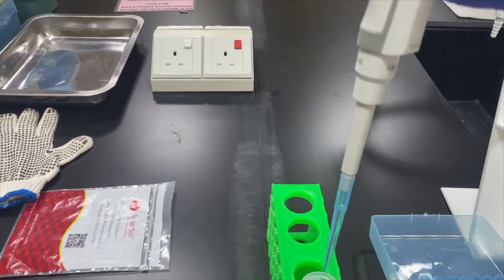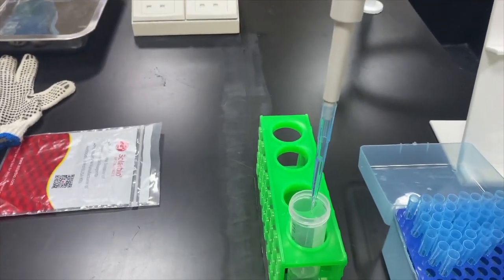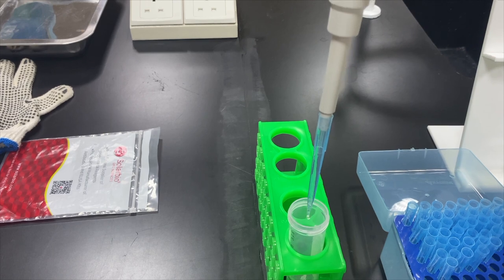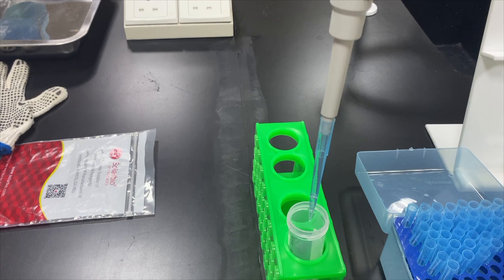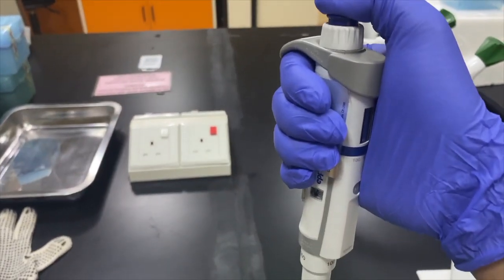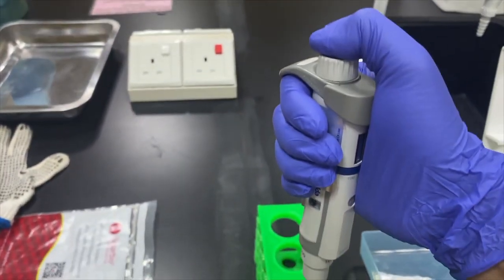The button and it will take around one milliliter. And if you want to dispense, you just press until one stop. But if you want to make it more accurate, you actually can press second stop and then you take first.